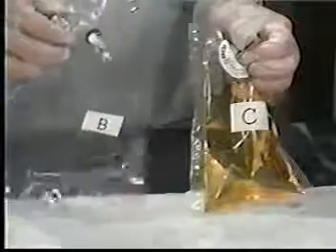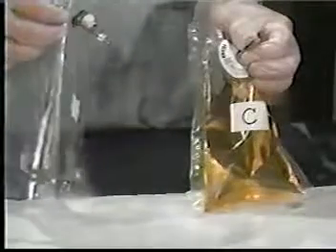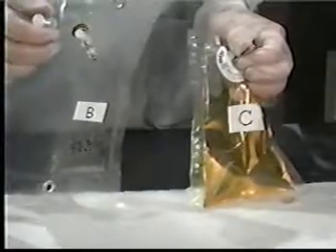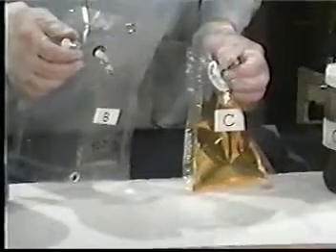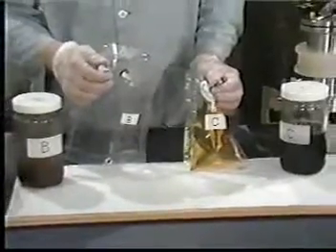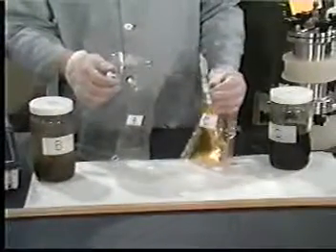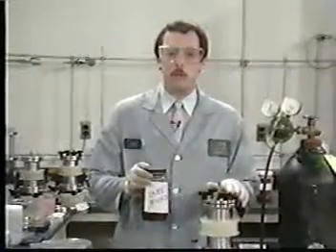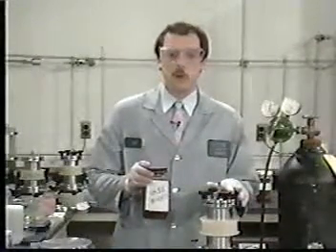For wastes like B and C that contain solids which will undergo extraction, store the initial liquid phase of the waste at 4 degrees Celsius under minimal headspace until it can either be recombined with the leachate of the solid, if water soluble, or be tested separately. Some oily and paint wastes, which are obviously liquid, may remain inside the ZHE. If this occurs, carry them through the extraction as though they actually were solid.